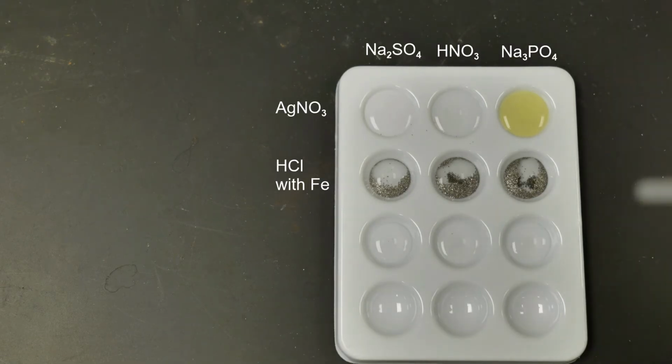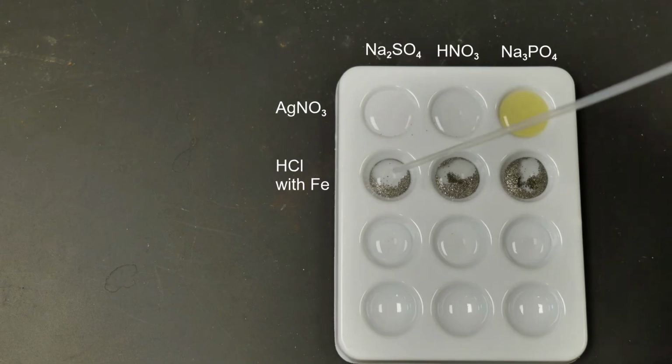Let's add in our 6 molar hydrochloric acid. Here we go into the first well. So this is hydrochloric acid with iron filings and sodium sulfate.